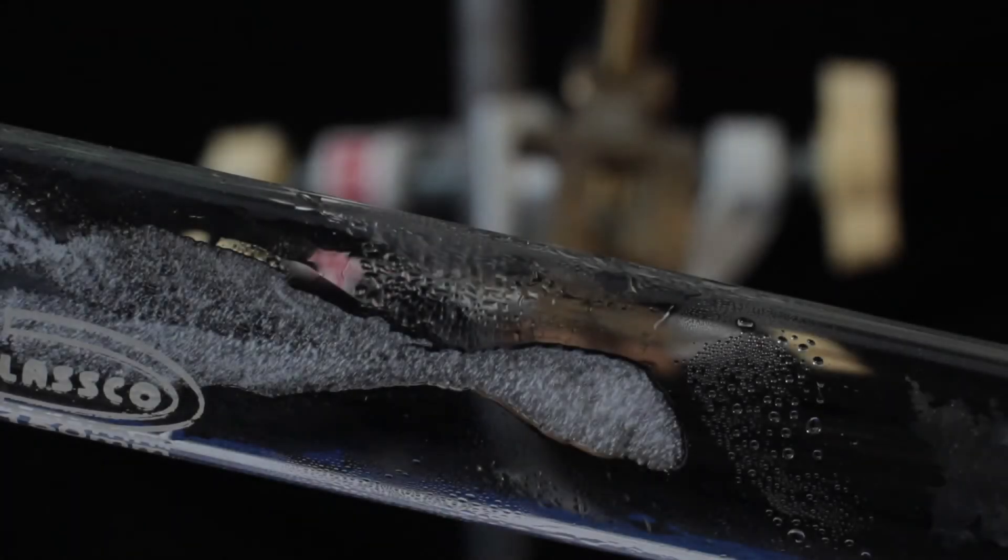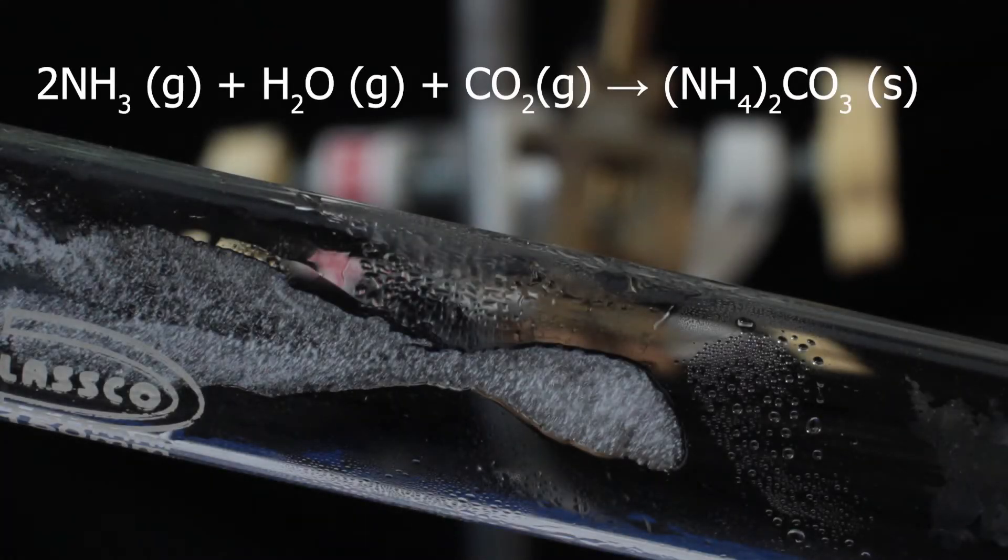But not totally into nothing. In the higher colder areas of the test tube, it can reform back again. It's not really sublimation, it's decomposition followed by synthesis. But this method can be used to purify ammonium carbonate.